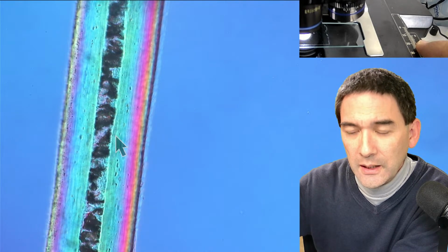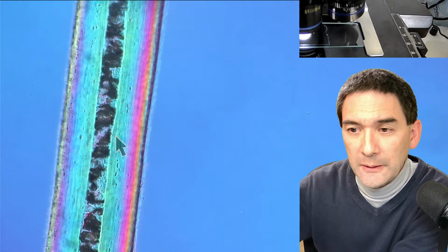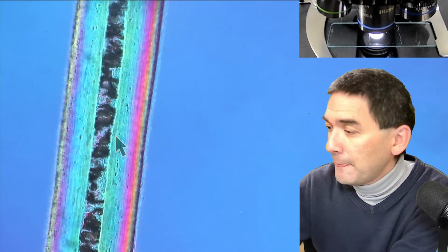Can you show a hair follicle or bulb? Yes, I have got a permanent slide, a very nice one that I would like to show you as well. Does the medulla determine the hair color? Not necessarily alone. I'm going to show you why.